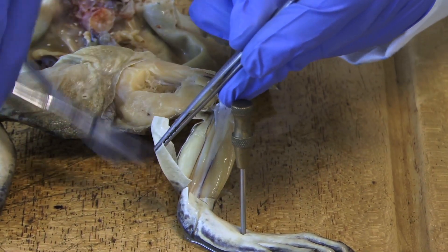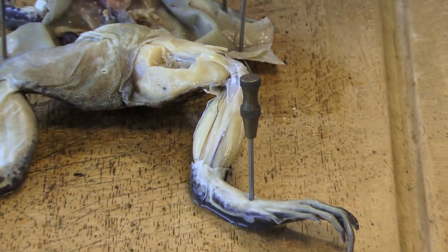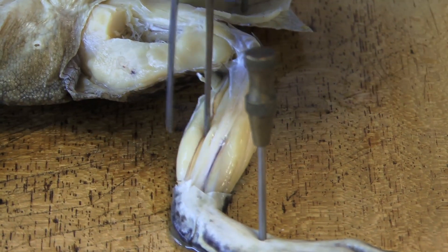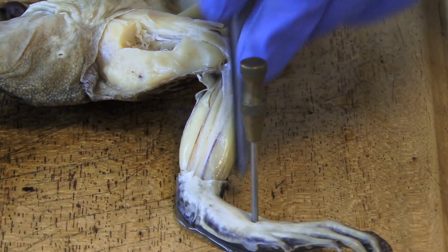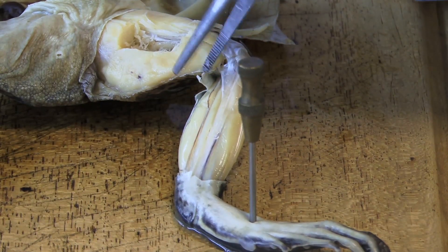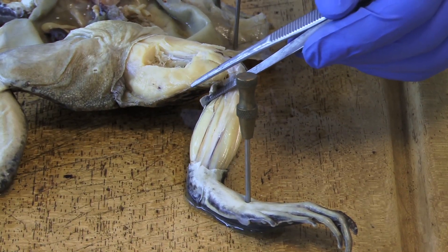A lot of muscle here — back calf muscle — and there you've got the muscle primarily at the front here. These work in an antagonistic fashion where one contracts and the other will relax.